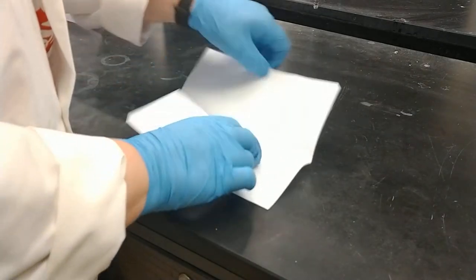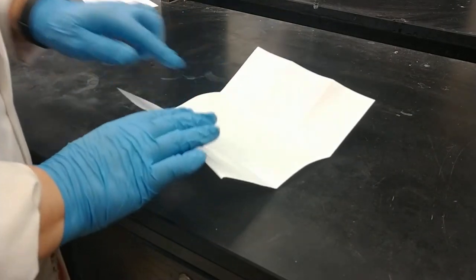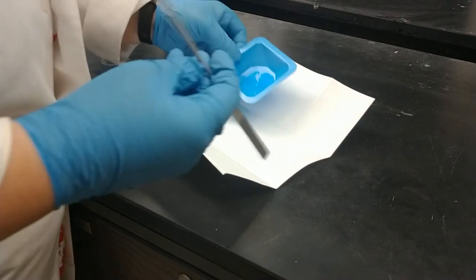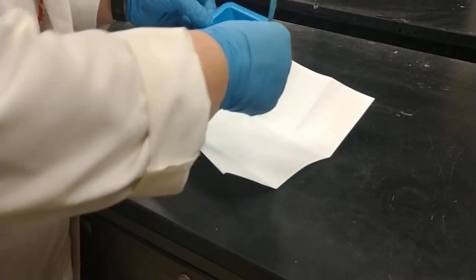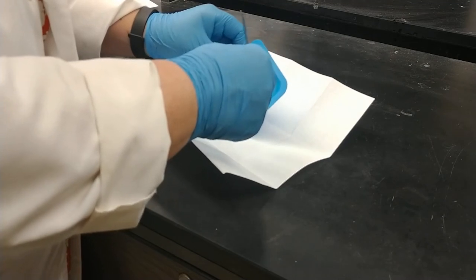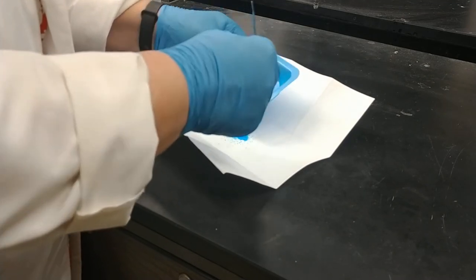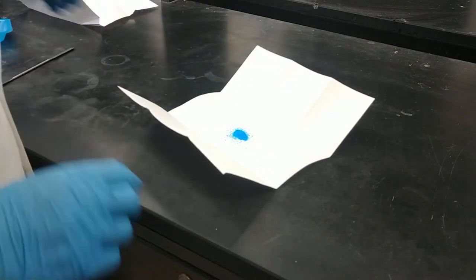The idea is that you're going to put your powder in here. A lot of people like to do the fold first because then it has little valleys to help keep your substance in the middle. I've chosen some nice blue substance so it's easy to see and track.